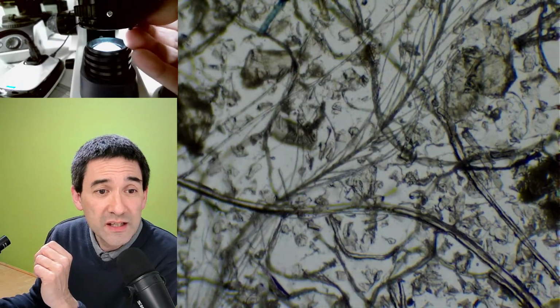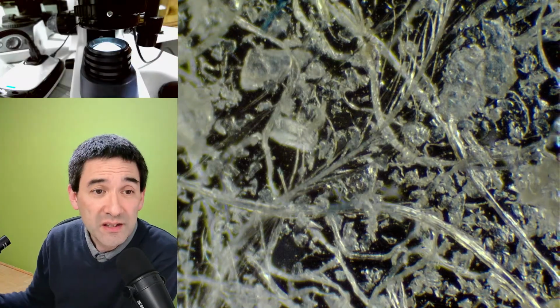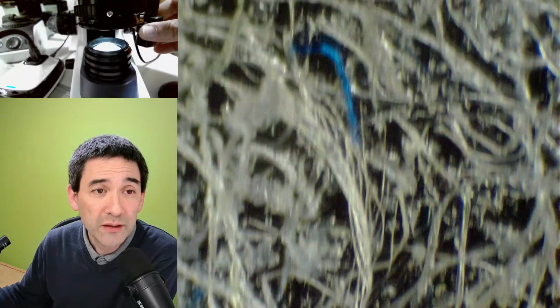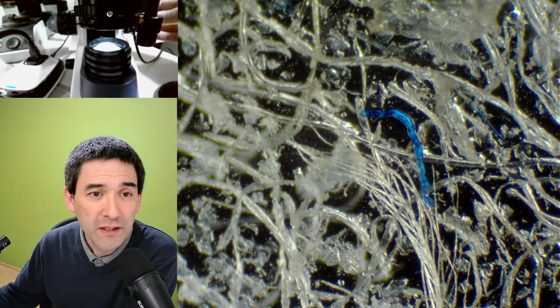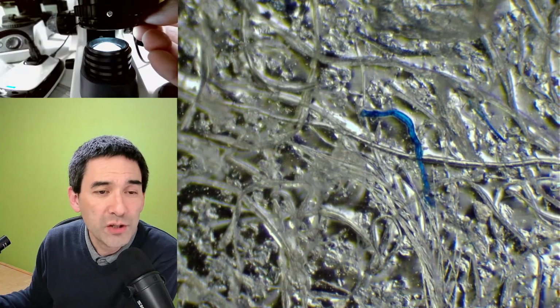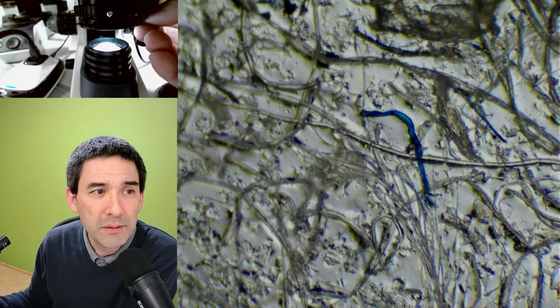I just want to show you this here. This here is what you see over here. This would be dark field. You see that essentially the dust and the dirt and whatever collected here appears bright on a dark background, right? You see those blue fibers here? That's usually some synthetic fibers, right? But when I swing out the filter a little bit and change the position, then sometimes you can get the impression that it appears a little bit three-dimensional.